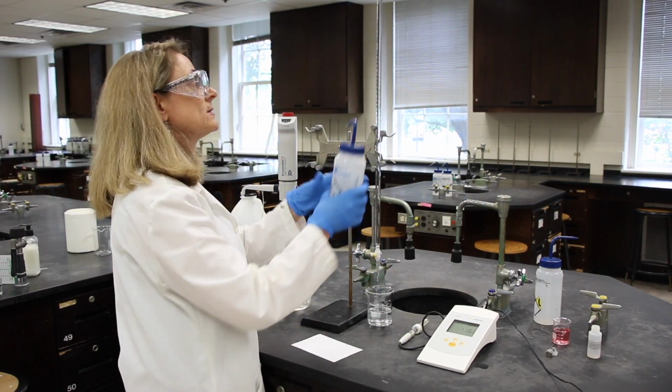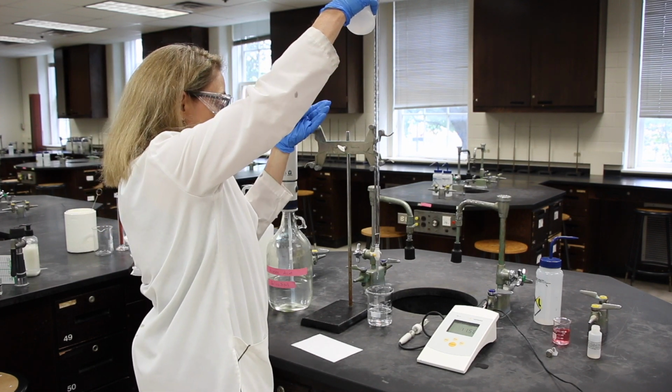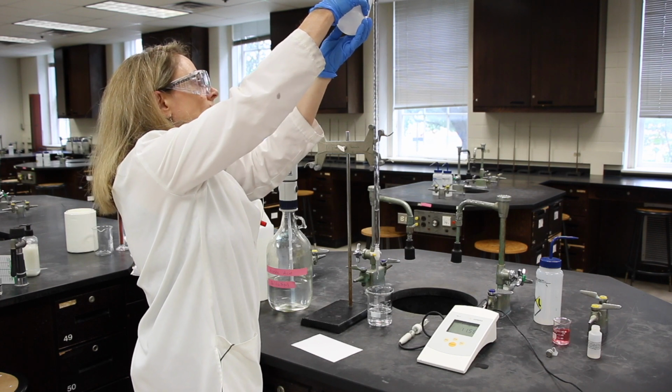And now I'm going to fill this up completely and let this drain.